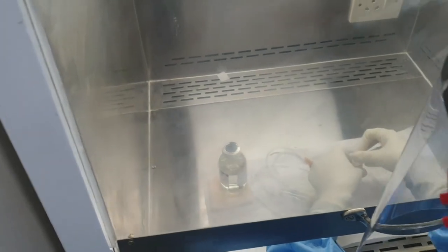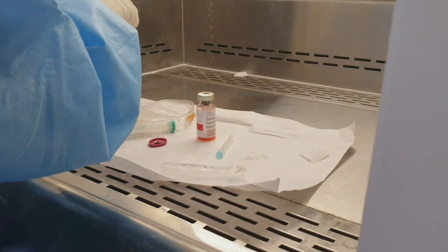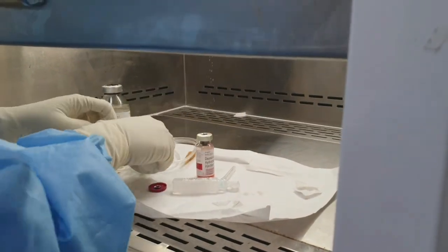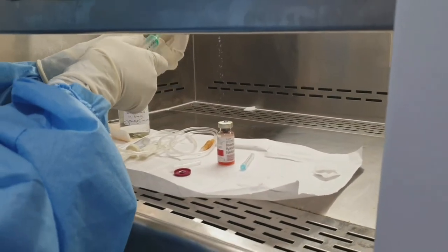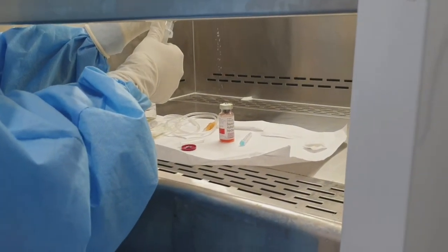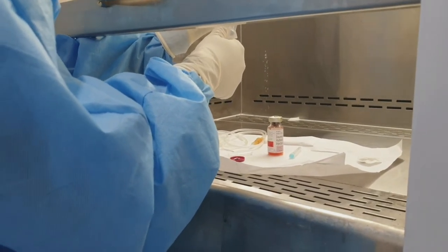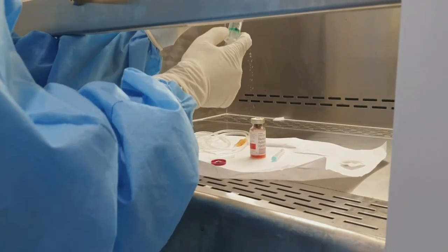Here is the drug Daunorubicin, which is an anthracycline drug. You can know it by the colour — it has a specific colour of orange, or you could call it a cranberry juice colour once you dilute it. This drug comes in powder form and is a sound-alike look-alike drug. Daunorubicin is a powder; Doxorubicin is a liquid form drug. You must never confuse between these two.